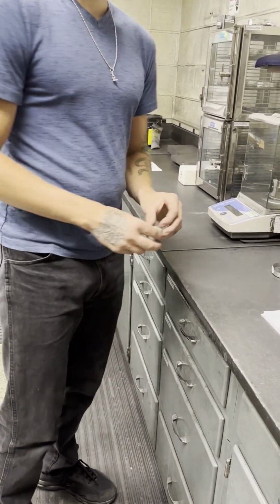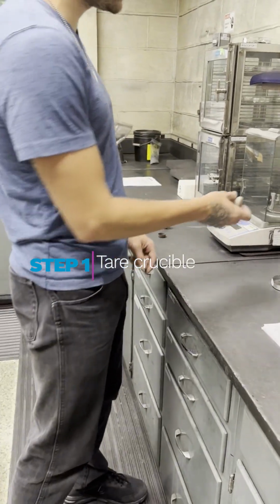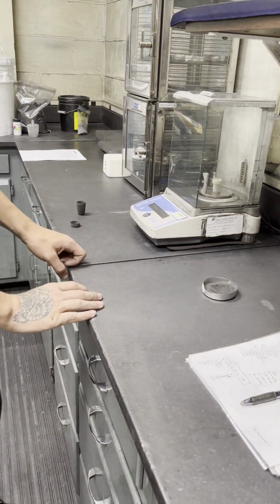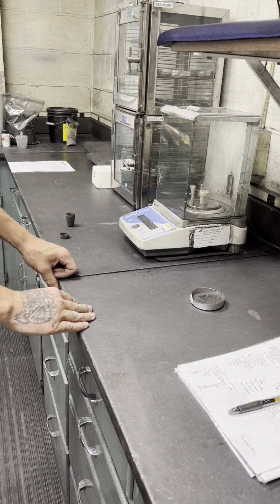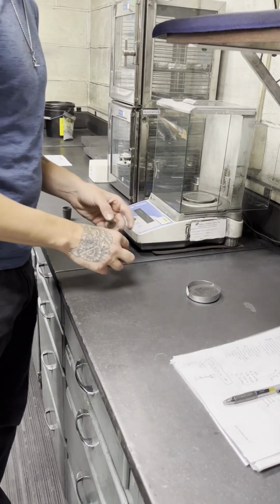The first step is you want to tare out the volatile crucible with the lid on it inside of our balance. Once you hit the tare button and you confirm you get an exact 0 reading, this is when we can add our material. Today we're just using standard synthetic graphite.